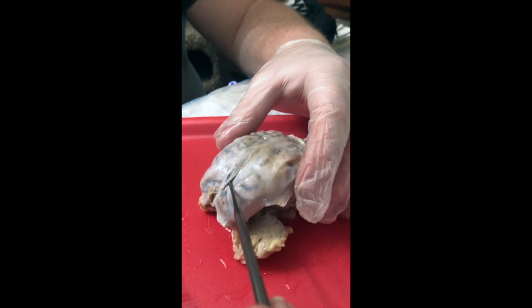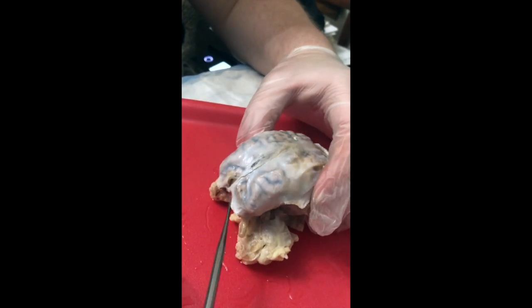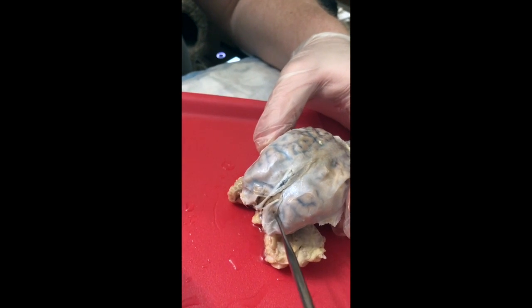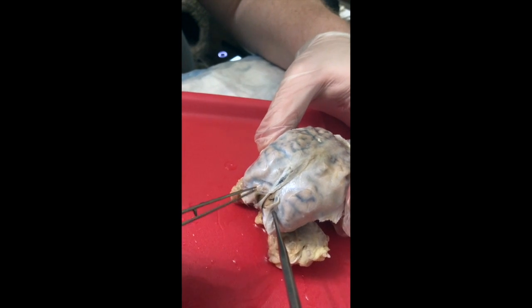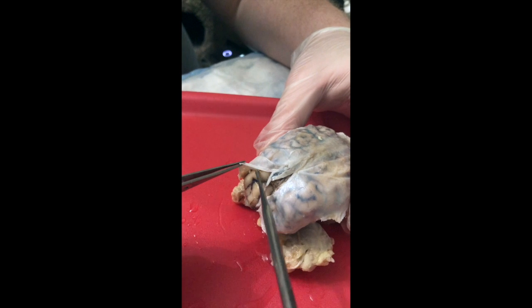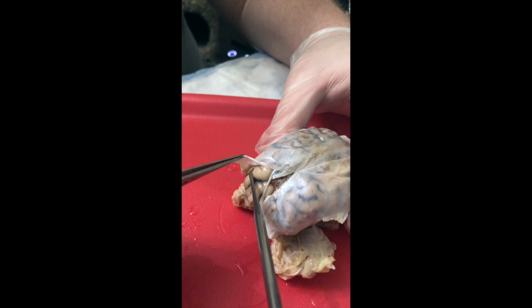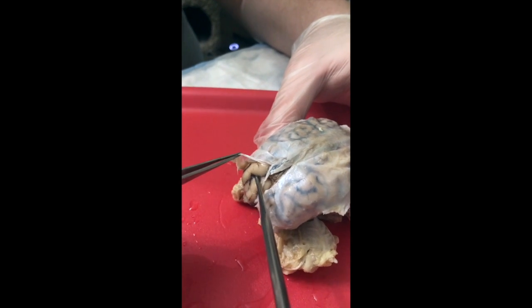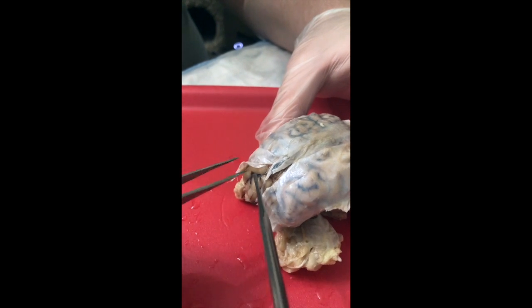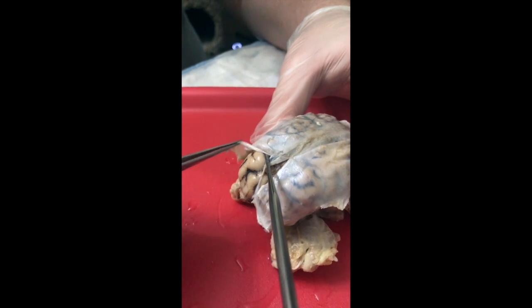These are the meninges. What you're seeing here on the outer surface, and there's a little incision here so you can see it lifting up, is the two outermost layers, the dura mater and the arachnoid mater. And you'll see this big space between the arachnoid mater and the surface of the brain. The surface of the brain is covered in this shiny, thin covering, which we'll look at more closely in a second, and that's going to be your pia mater. But this space here in a living brain would be filled with the cerebrospinal fluid.